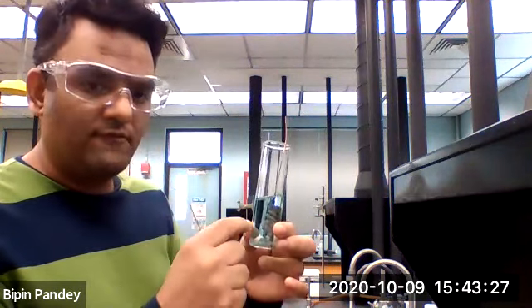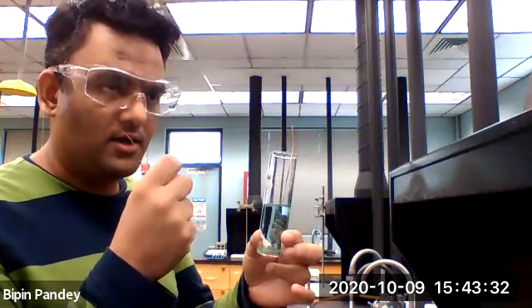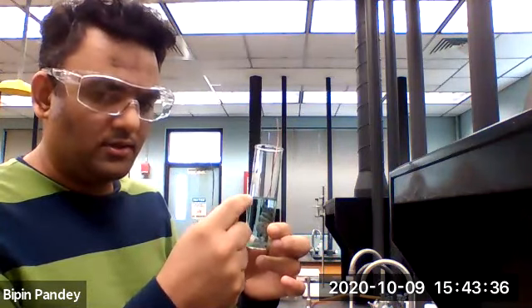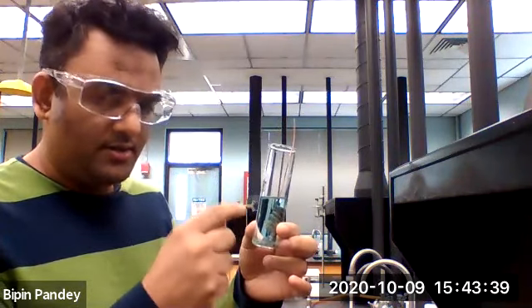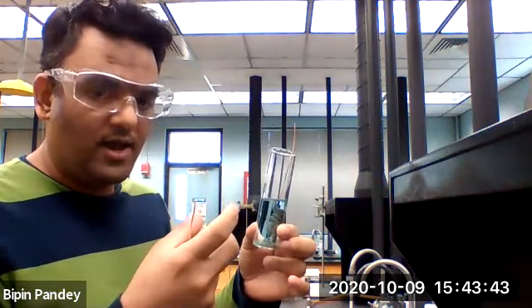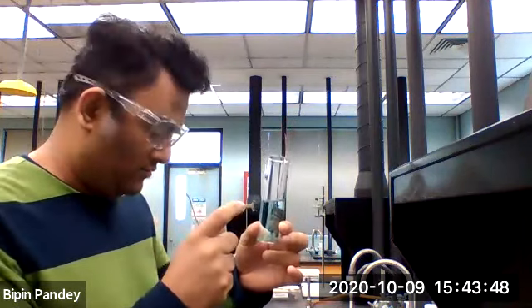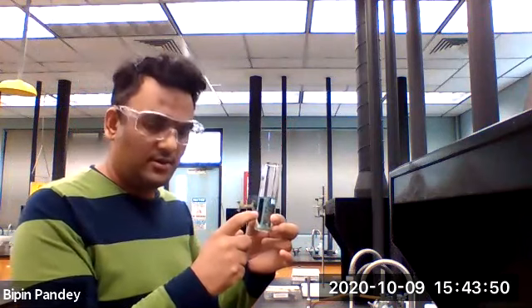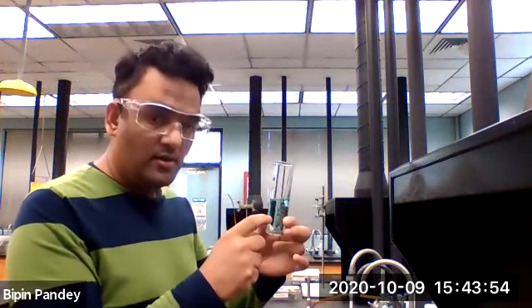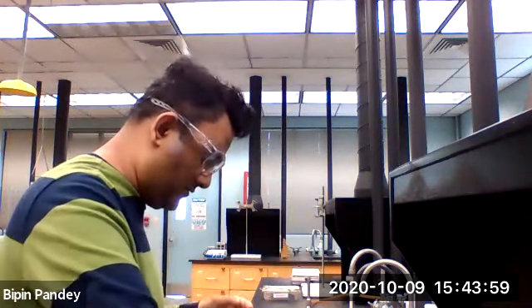The silver in the solution gets electrons from the copper, and copper goes into the solution, and that's why the solution is bluish in color. As the silver gets electrons, it becomes a silver atom and gets deposited on the surface of copper. This is the 3rd time we have seen this reaction, right? So this is a redox reaction.